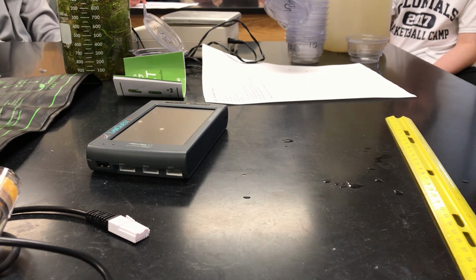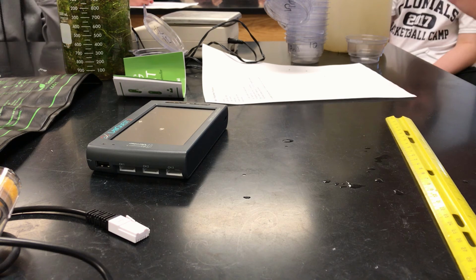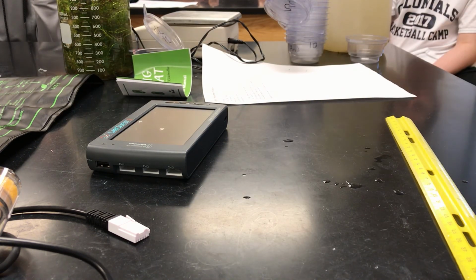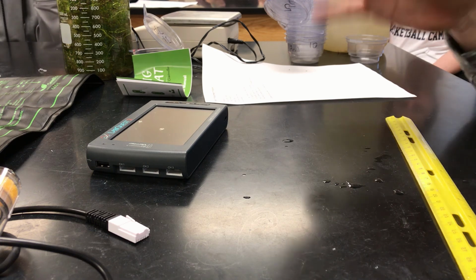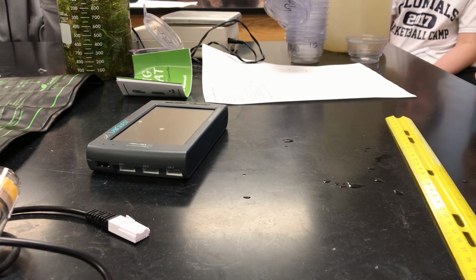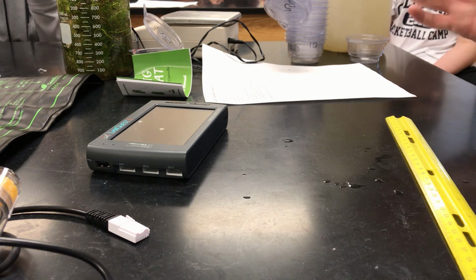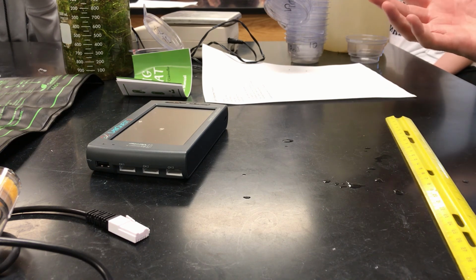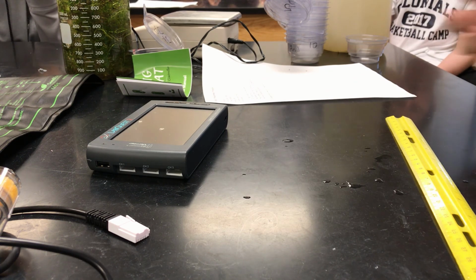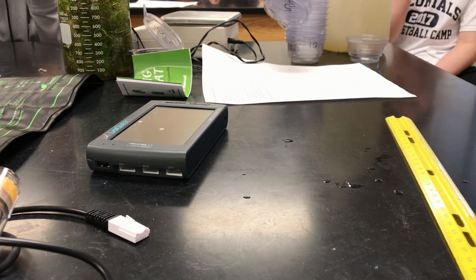Right. But you could also do a negative control, which are cups with just water in them exposed to the same thing, because do you know what the dissolved oxygen rate of aged tap water is at that high temperature? The answer is you probably don't know. So we do need to see what happens to dissolved oxygen. And I will say that temperature does affect the dissolved oxygen rate of just water. So that will change. So the question is, how much of that change are we seeing because of the plant versus how much of that change are we seeing just because of the chemical properties of water being exposed to heat?